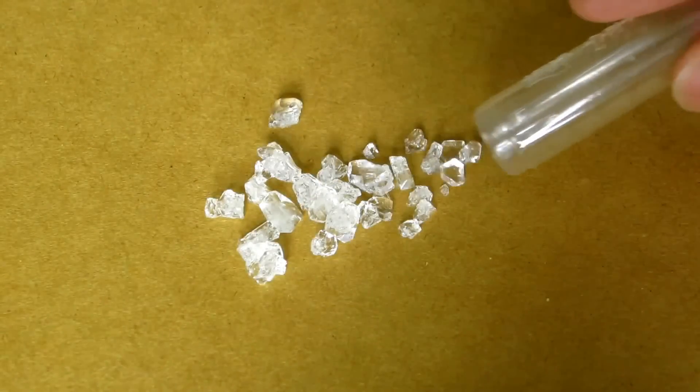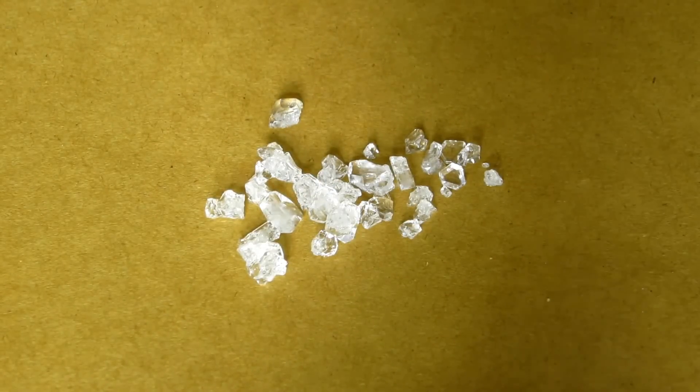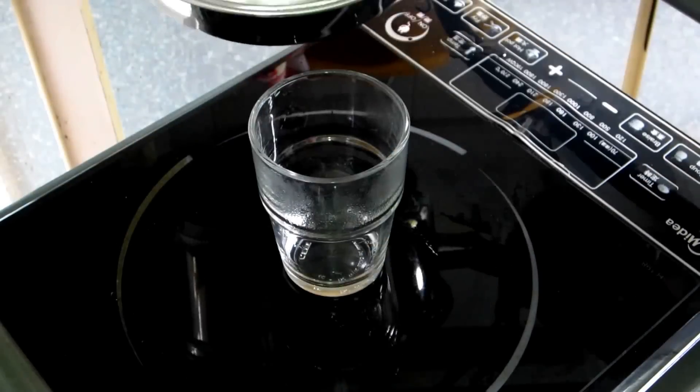To grow a larger crystal, you need to prepare seed crystals. Here's how. Pour hot water into a clean jar.